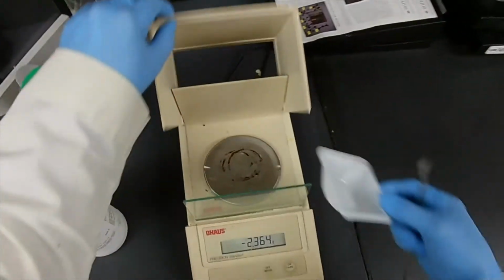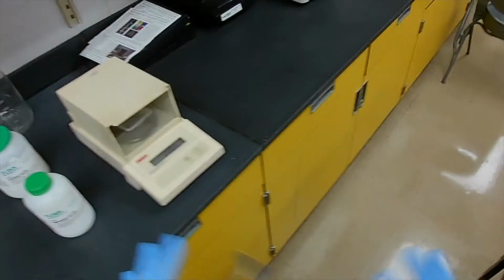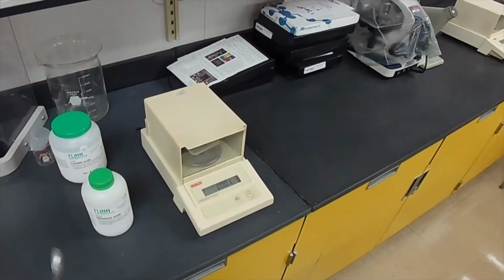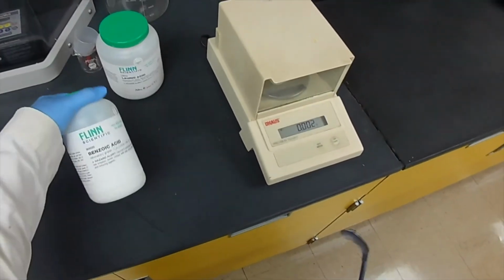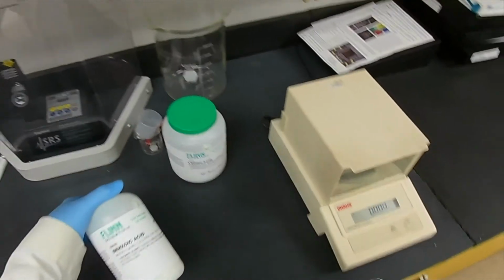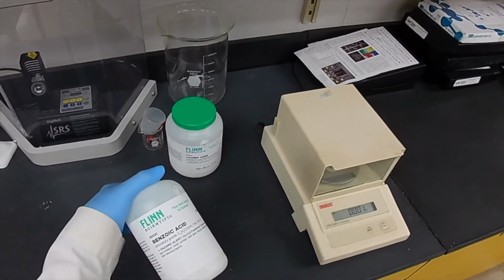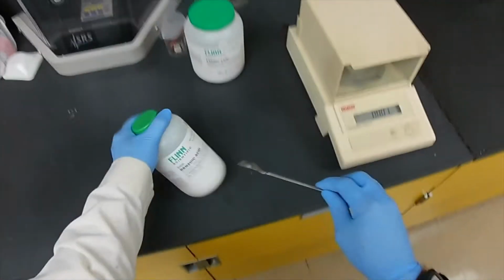Now I mentioned colligative properties earlier, but I didn't really define what a colligative property is. When you do this lab, you should have been introduced to the concept of colligative property, and it's very simple. A colligative property is any property of a substance that does not depend on the chemical nature of the substance. In other words, we could put anything that will dissolve in lauric acid. Benzoic acid, we could use any other substances that will dissolve in lauric acid, and the only thing that matters is their concentration in lauric acid. It doesn't matter what the benzoic acid is. The freezing point depression will still be the same based only on the molar concentration of the solute.